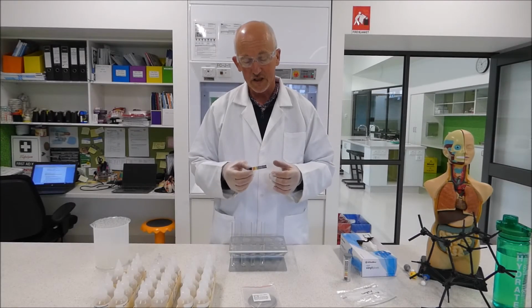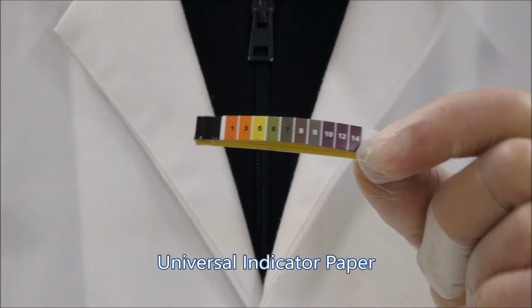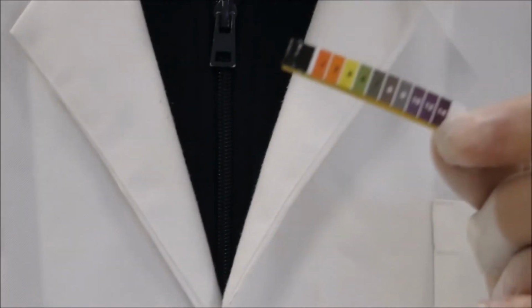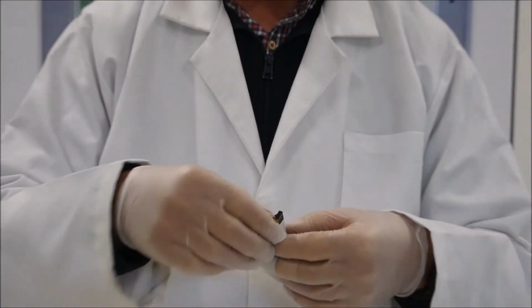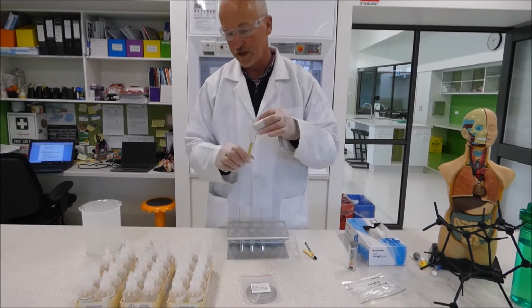Alright, so our first experiment or our first chemical reaction will be with universal indicator paper. Now if you can zoom in on that, now our solution is going to be quite acid, so the universal indicator paper is going to turn a dark orange colour. Well, that's what we hope at least, so we'll see how we go. We'll tear off a strip and we'll put it into our test tube. Drop it into the test tube.